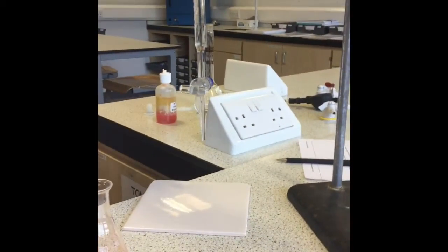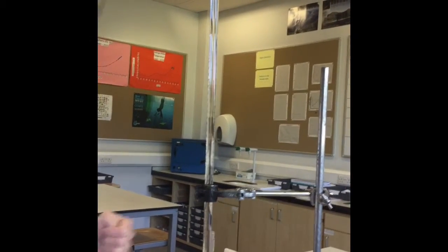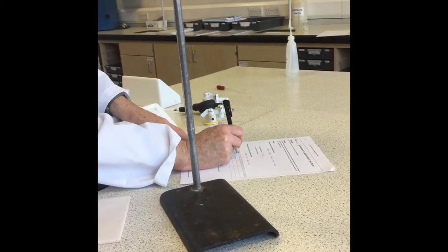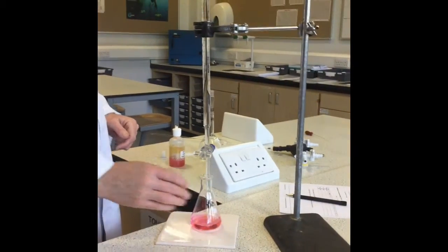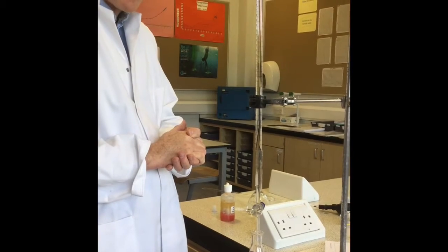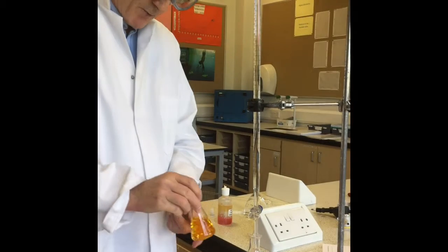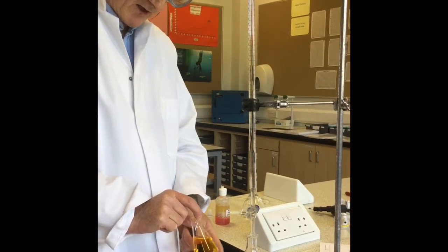I have already washed out the burette and filled it up with our standardised sodium hydroxide solution. So I record the starting volume for our rough titration in my lab book, and then proceed to do the rough titration, and then as many accurate titrations as is required to get concordancy, remembering that at our end point we should see a solution which is more yellowy orange rather than pink.